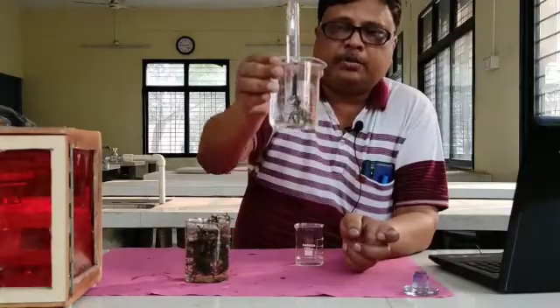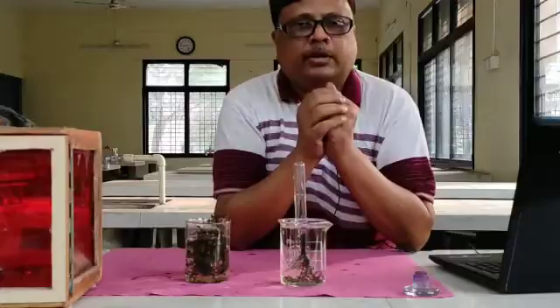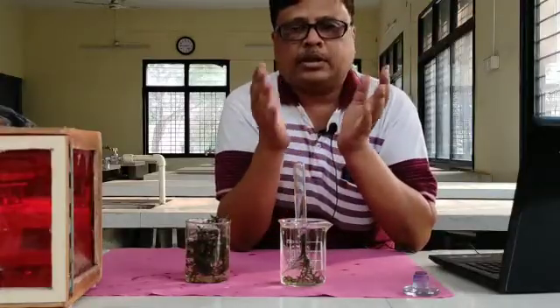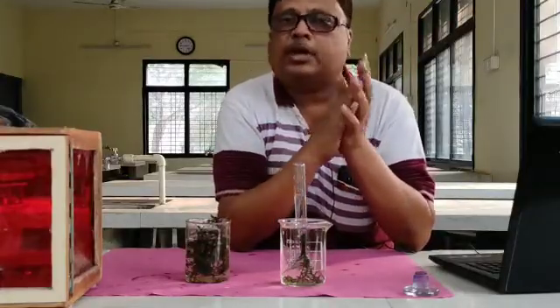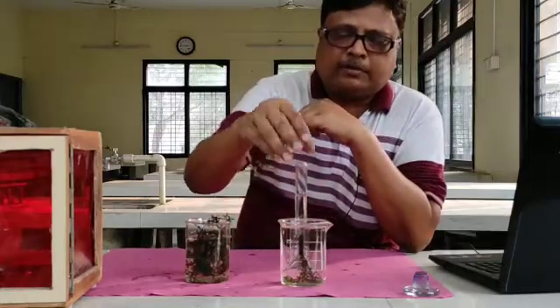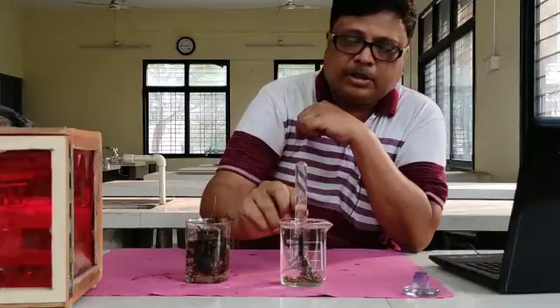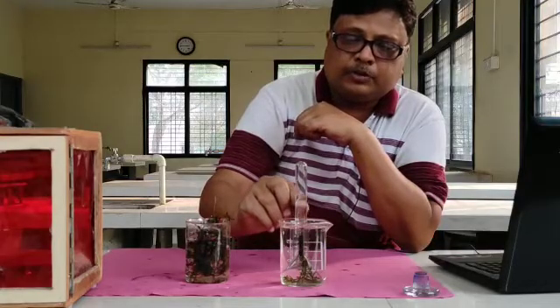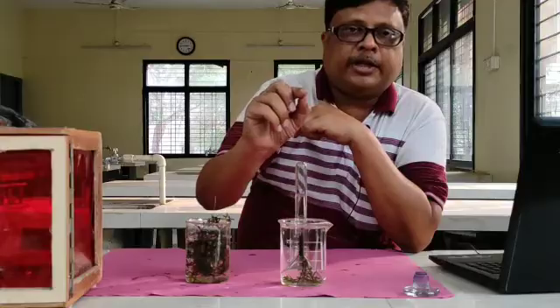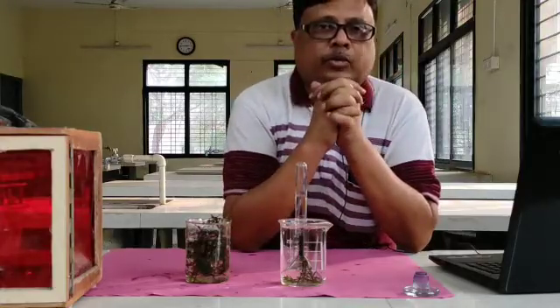This is the Wilmott Bubbler. Now put this bubbler into the sunlight — either in the campus or in a room with light. In the presence of light intensity, after 5 to 10 minutes, small bubbles can be seen from the inverted surface of this Wilmott Bubbler, and that is the evolution of oxygen.